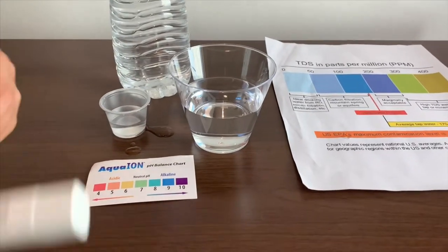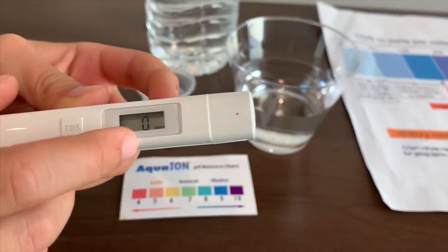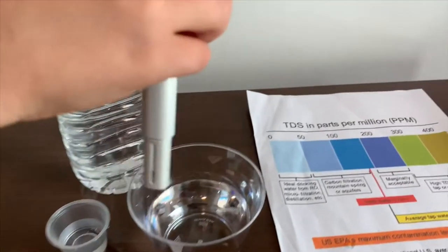First, we're going to test the TDS level. Turn on the TDS Tester, make sure it says 0, and let's put it in.